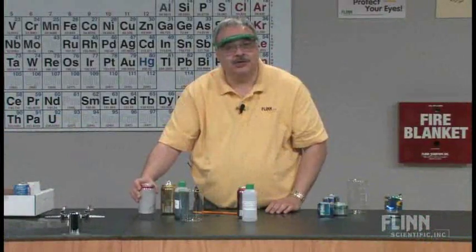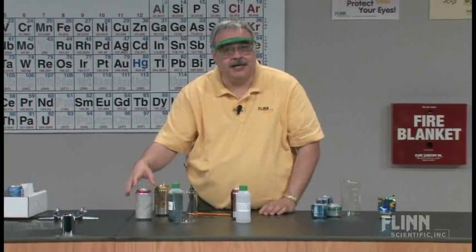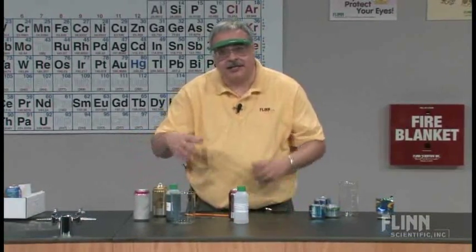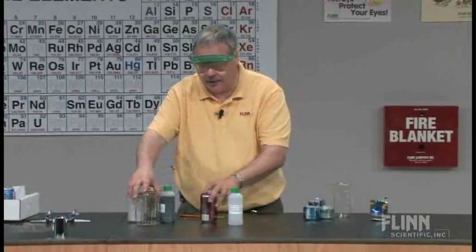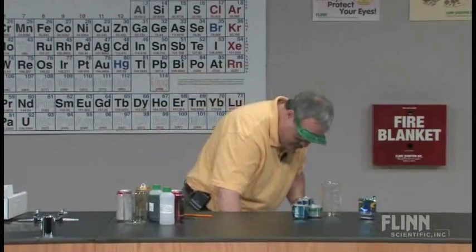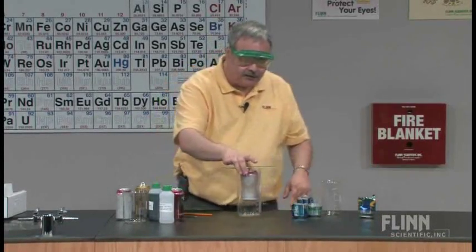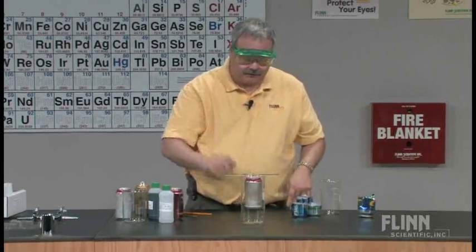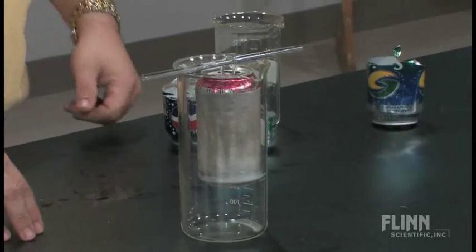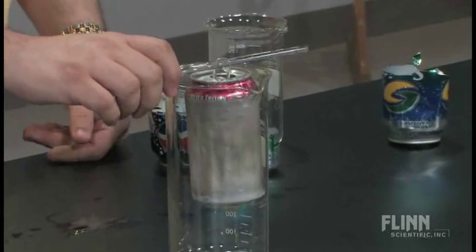Ultimately it's going to start reacting with the aluminum in an oxidation-reduction reaction, it's going to get rid of most of the aluminum can, and what you get is something like this. This is a static demonstration that, if you're careful, you can have it last for years. I keep a little water in there — you try to gently, delicately rinse it out — and there's what you have.